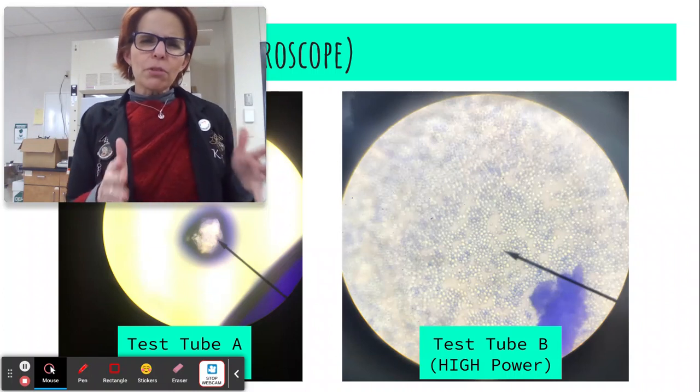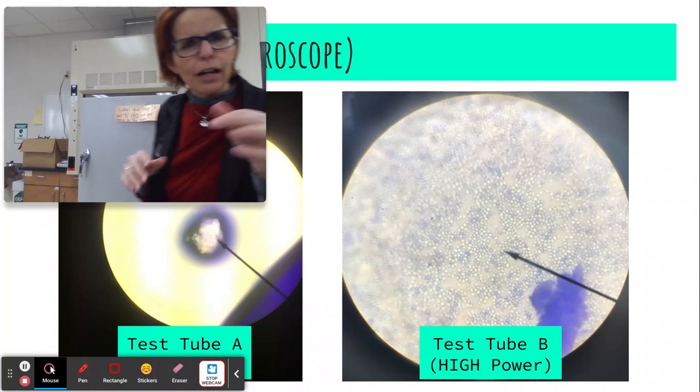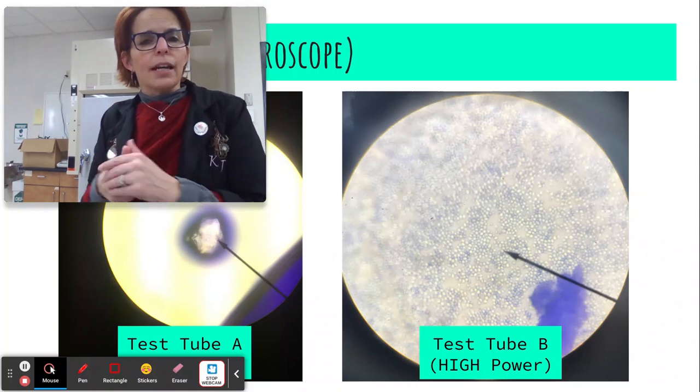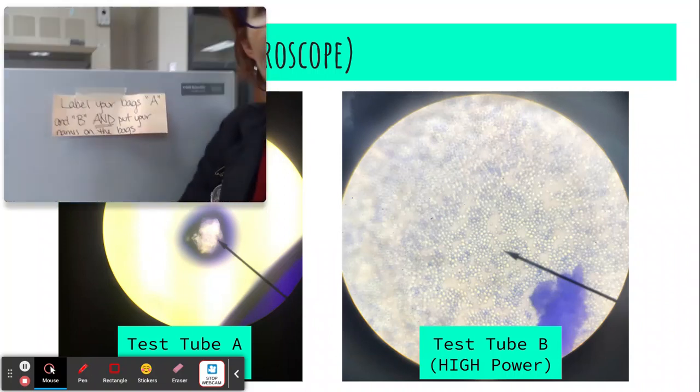And now it may have been too early, but I'm going to check our incubator. If it doesn't look good, we'll check back. I'll pause the video and we can look in 10 or so minutes. Let's see if there's any difference between the two samples when they've been fed. Okay, so let's take a look.